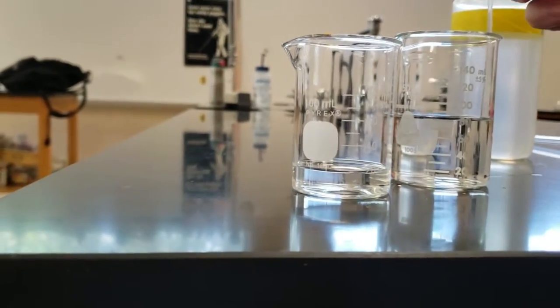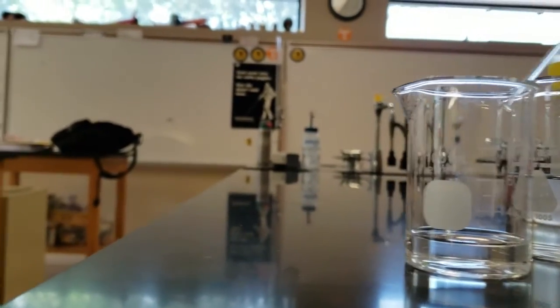Again, this camera angles a little bit at an angle. We need to look at it so there's a single line going across, not an ellipse. So I need a little bit more still. It's tough to see. Sometimes you can put a clean white sheet of paper behind it, and it's easier to look to see. You can see I'm adding quite a bit just to make it as close to 20 as I can get.